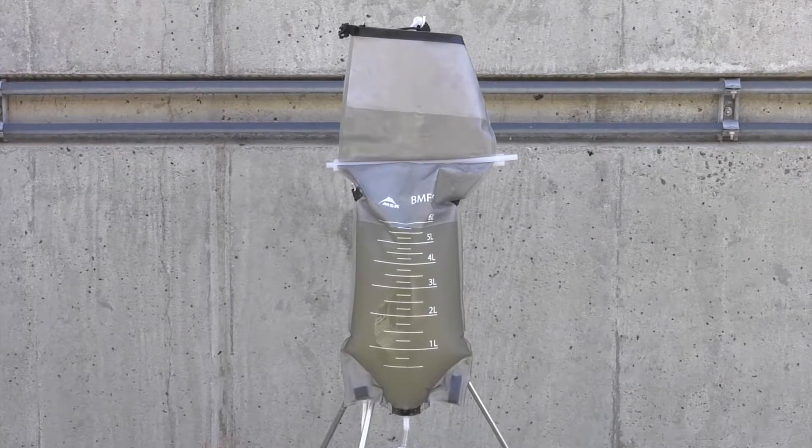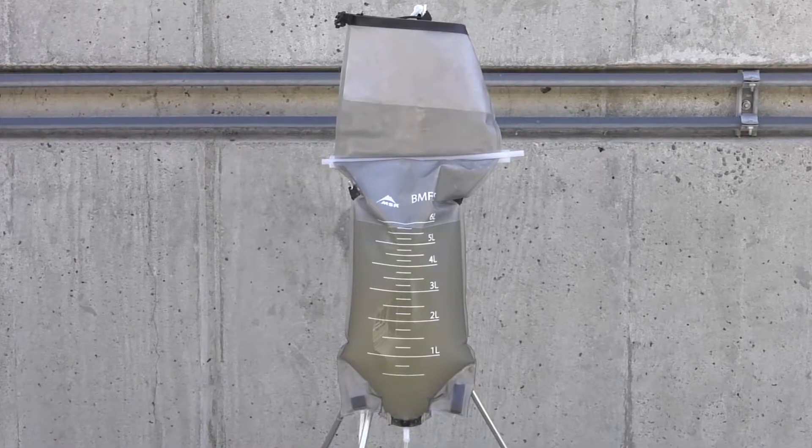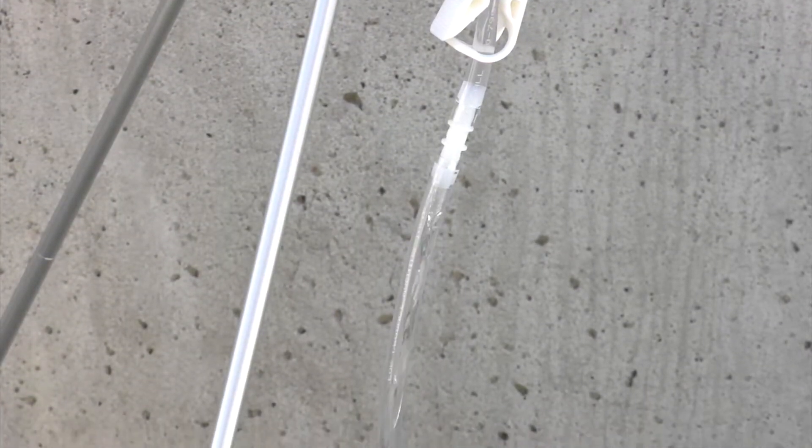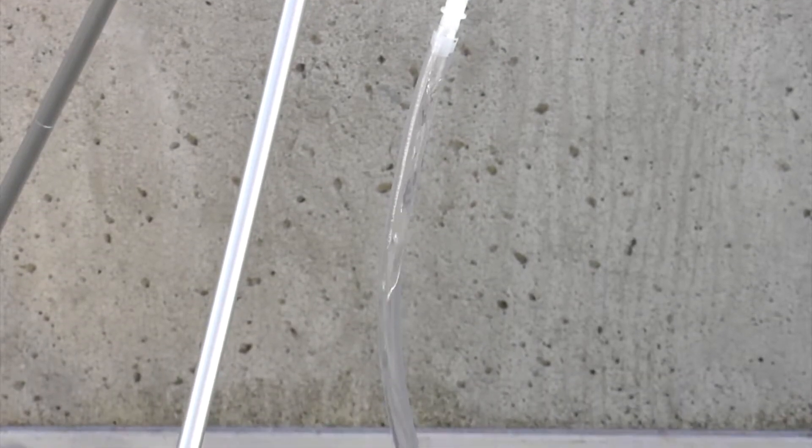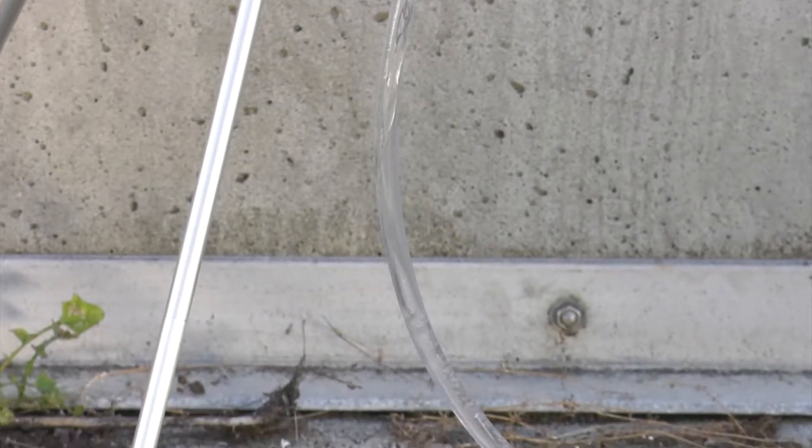In our previous video, we talked about the importance of environmental surveillance for monitoring pathogens. We also introduced you to the field aspects of the bag-mediated filtration system, or the BMFS.